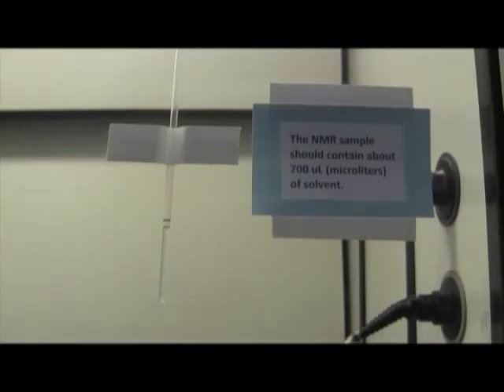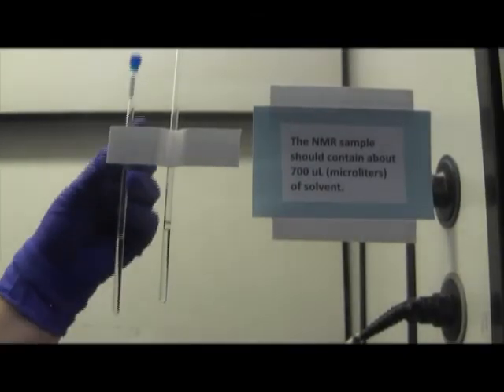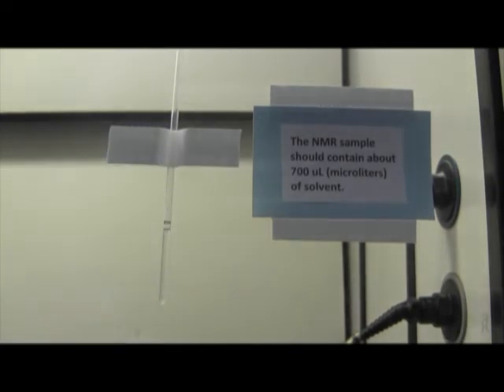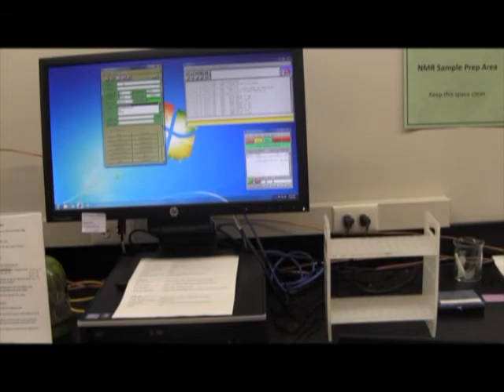Double check by comparing your NMR tube with the sample taped on the hood. Then cap the NMR tube and take it to the NMR input room, 203, which is in between the two intro labs.